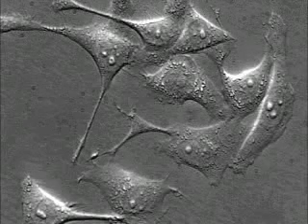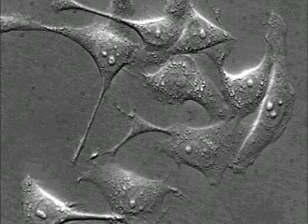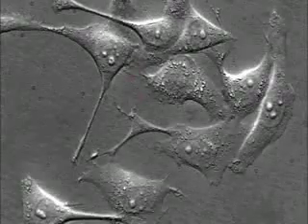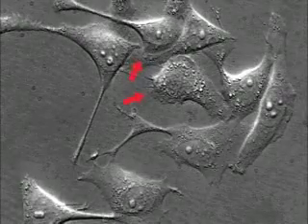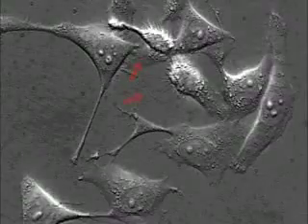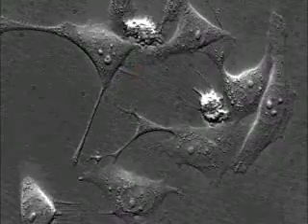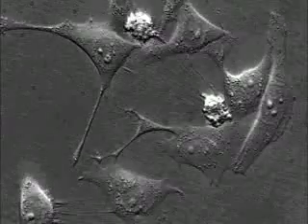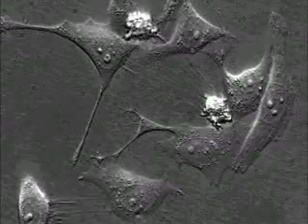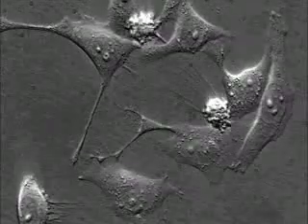Programmed cell death, or apoptosis, has been induced in these cultured cells. Cell death is characterized by blebbing of the plasma membrane, which gives the cell surface the appearance of boiling water, and fragmentation of the nuclei.